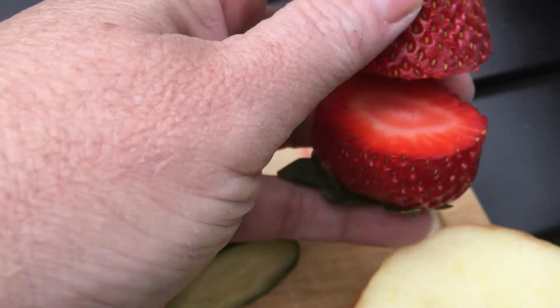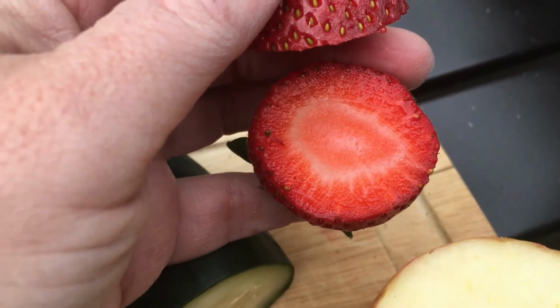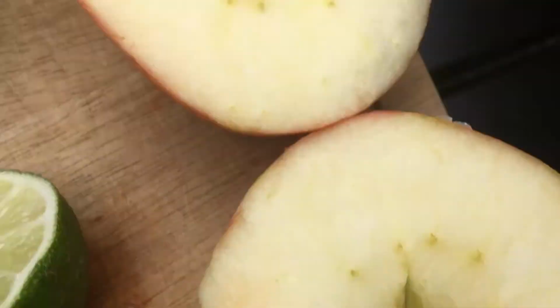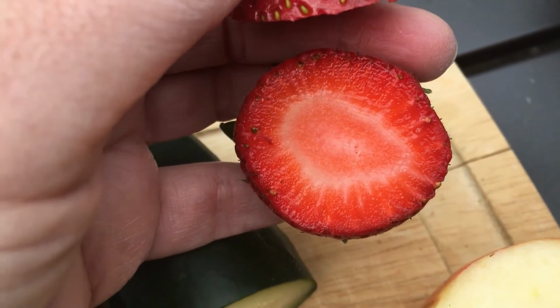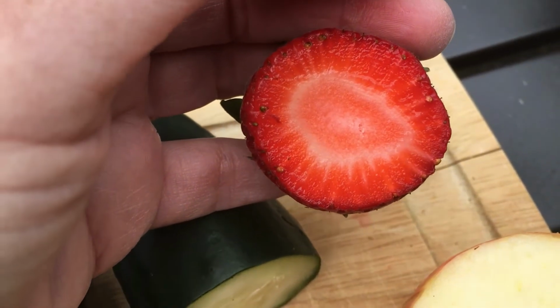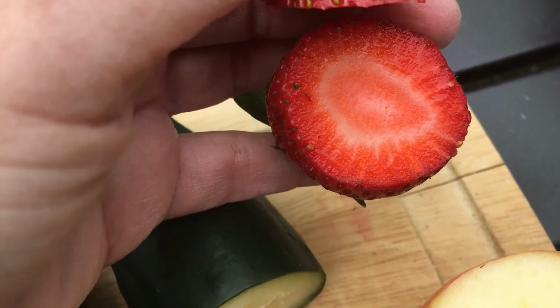They have the fruit wall on these little achenes that are attached to this fleshy receptacle. And when you look inside the strawberry, you don't see the seeds on the inside, and you don't see any of that carpel structure like you see in the apple, where it has that 5-parted carpel structure. That's not in the strawberry because it's not coming from the carpels or from the ovary itself. It's coming from the receptacle. So this looks more like a stem with the vascular tissue and the cortex tissue and things like that. More like a stem arrangement.